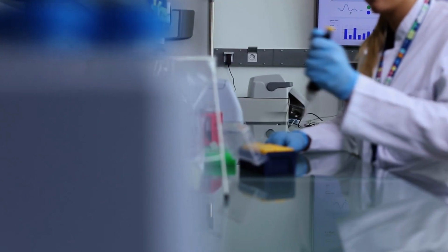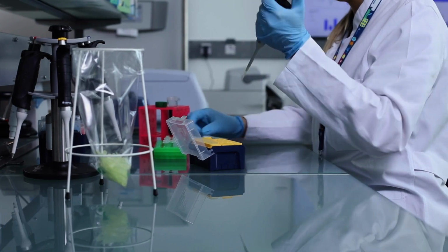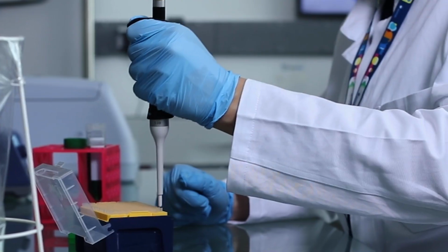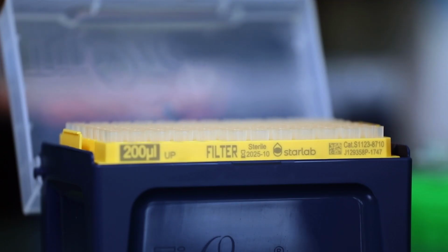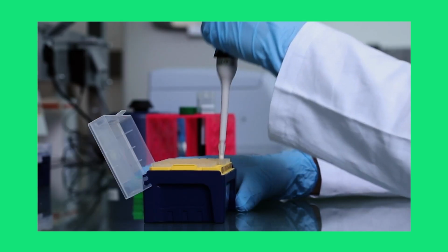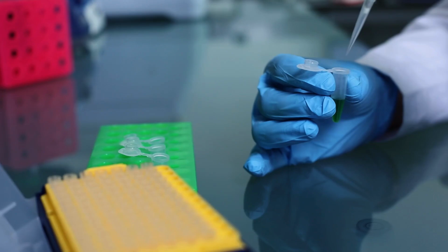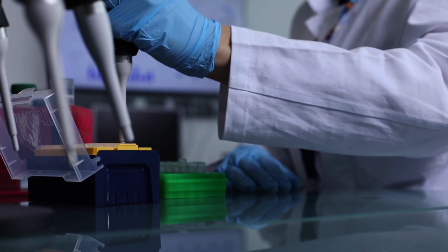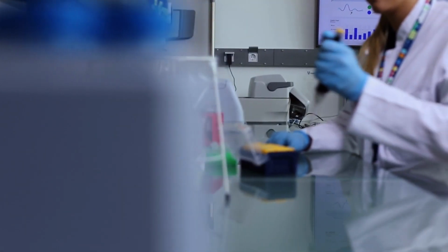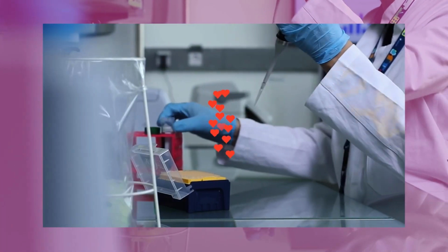I have feelings too. If you have to use force to get a tip onto your pipette, something might be wrong. If you have to use pressure to fit a tip, the tip cone of your pipette may be damaged and need repair. Let's take a look at how the pros do it. First things first, make sure you are using high quality tips and a well-maintained pipette, like a real pro. Poorly fitting tips will not provide accurate results. Next, make sure to treat me right. A gentle push into the pipette tip is enough to get things fitting securely. So, if you need to use force to get things to work, something might be wrong. Gently does the trick.